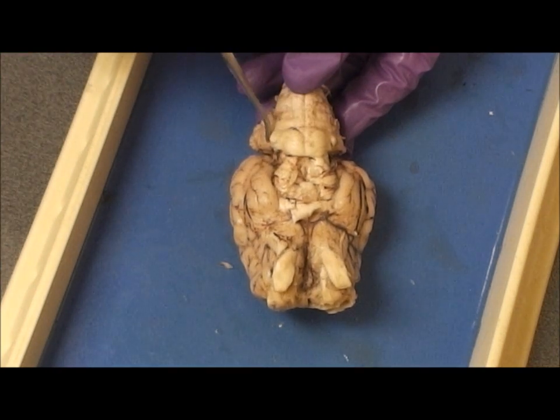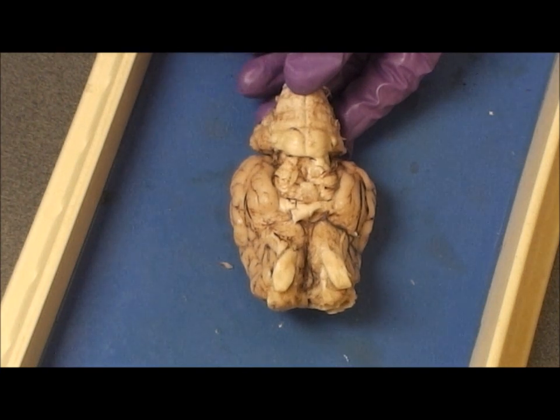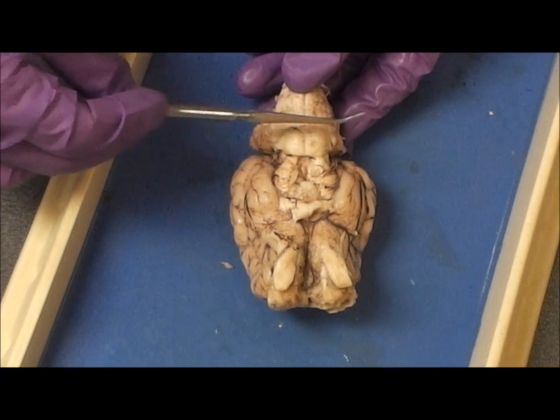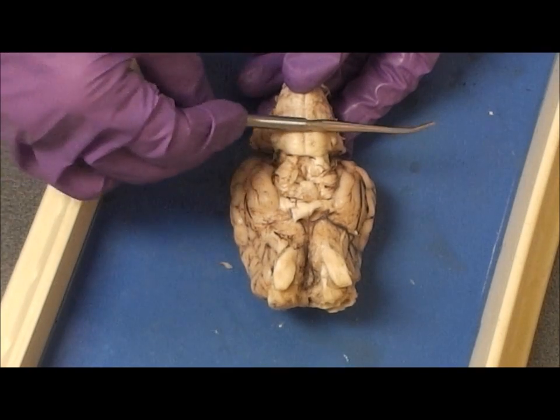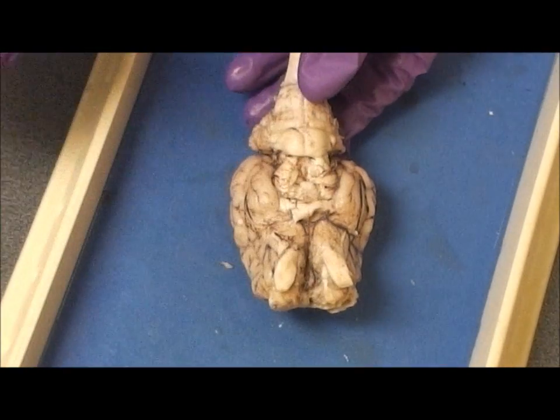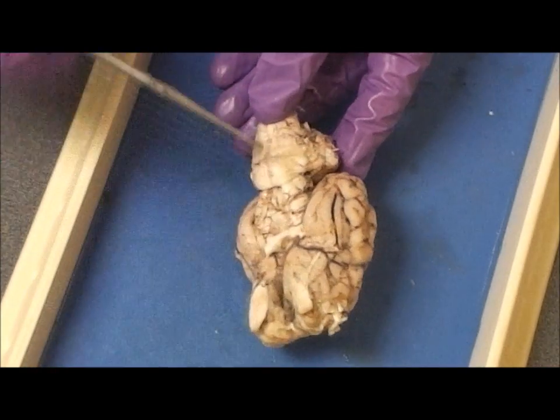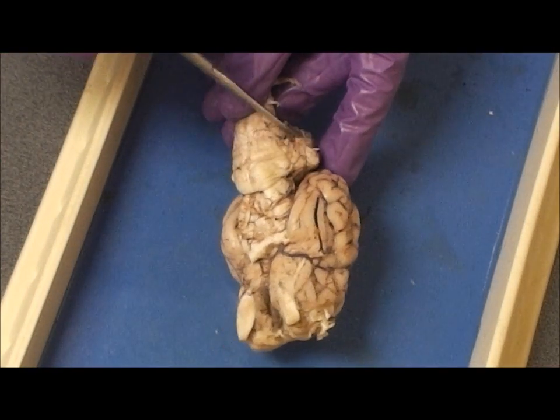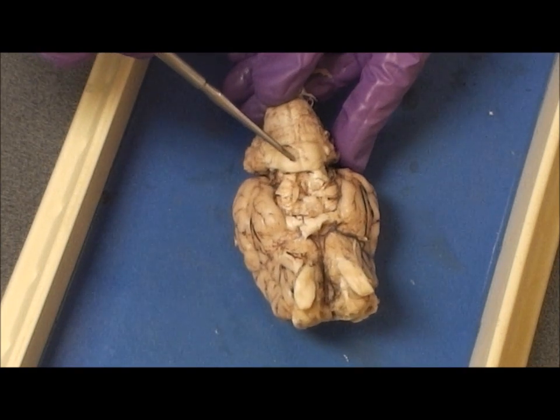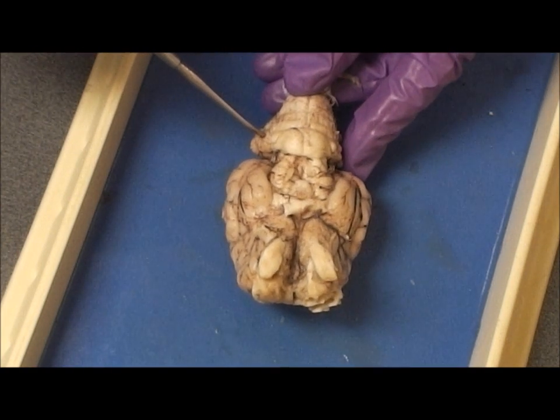The part of the brain just caudal to the midbrain is the pons, and you'll notice the fibers running at right angles through the long axis of the brain. If you follow those fibers, you will end up in the cerebellum. Those are the transverse fibers of the pons.